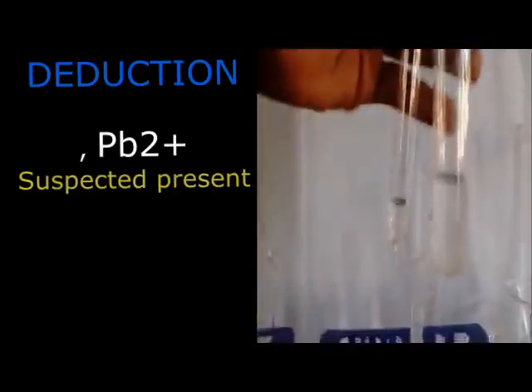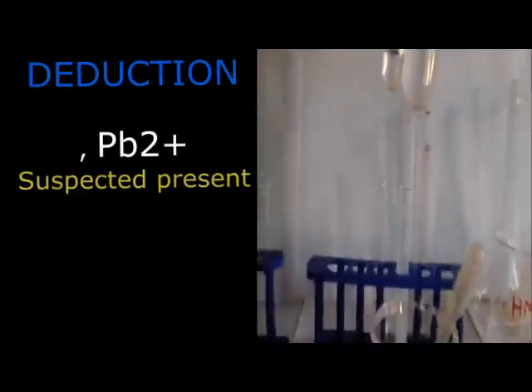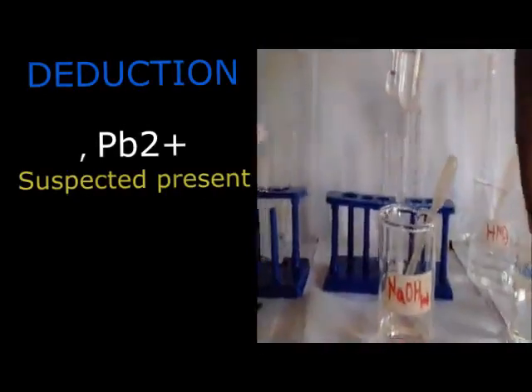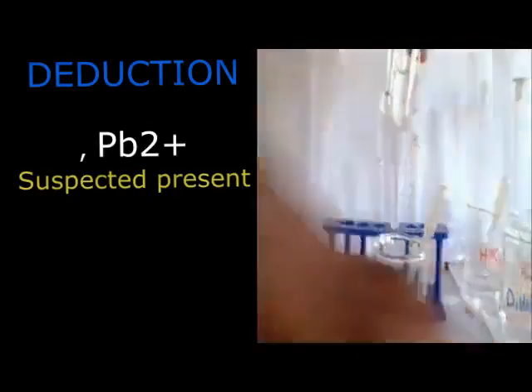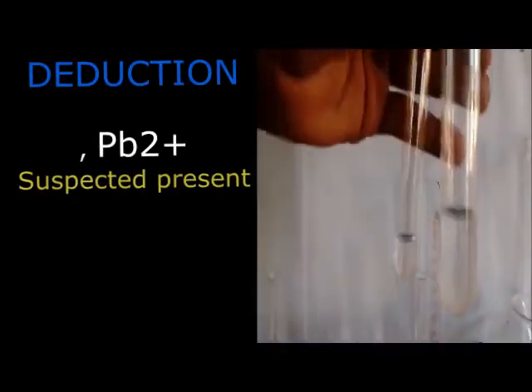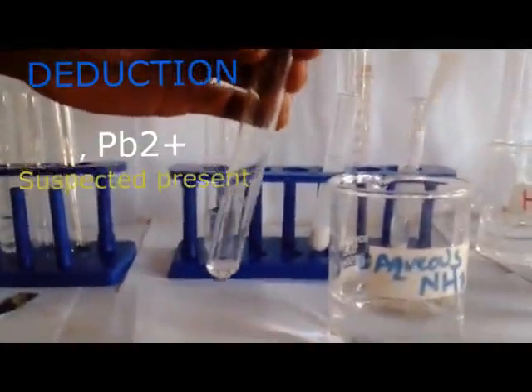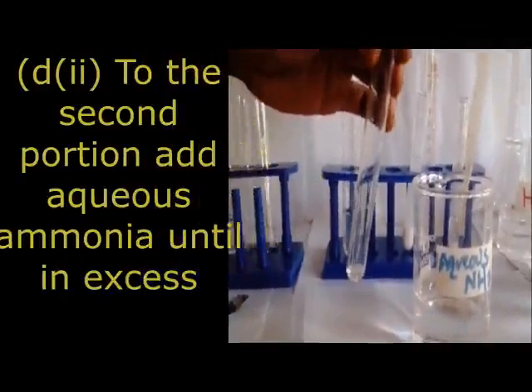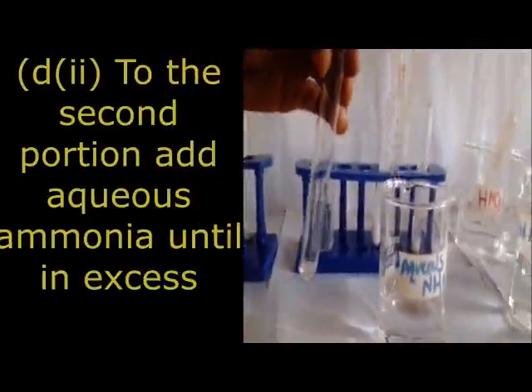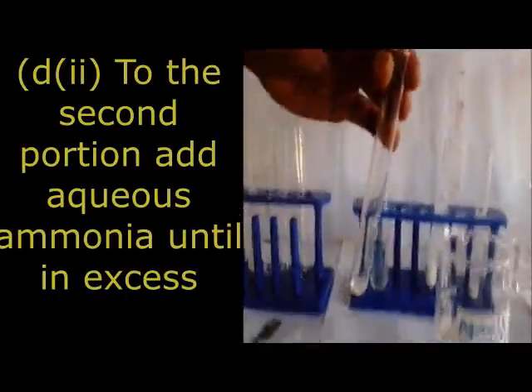Both of them are colorless solutions. You can see, if we are comparing the two, this is colorless and the other one is colorless. But the other one was for water, the other one was for sodium hydroxide. So you added the water, then you added the sodium hydroxide. Now you are going from colorless to colorless. But remember this one, it was a white precipitate which dissolved to form a colorless solution.